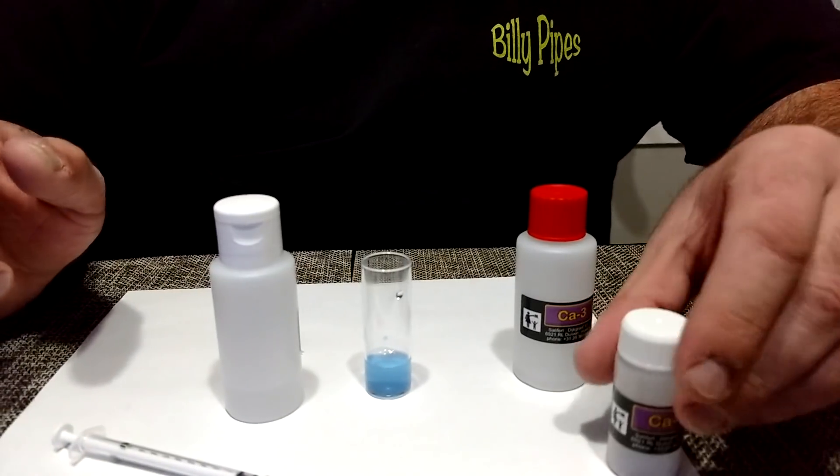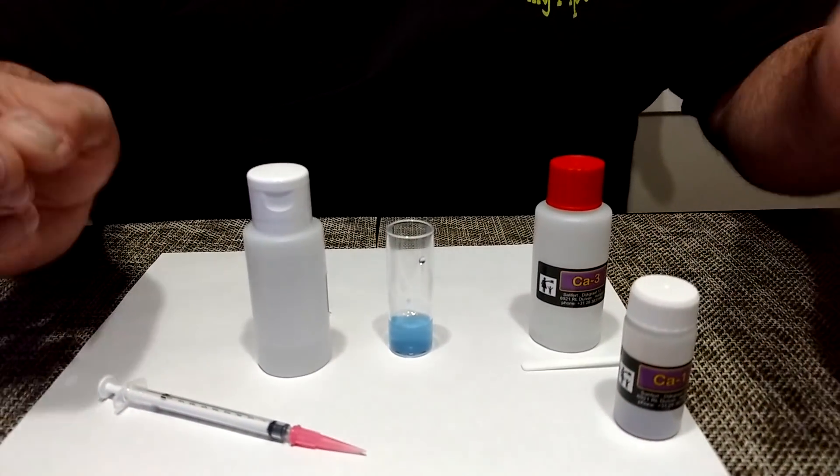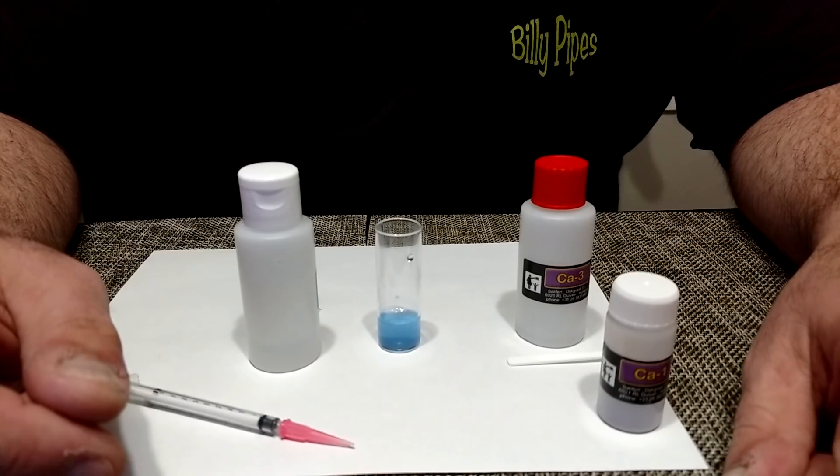So that is exactly how easy it is to use the Salifert calcium test kit. I'll see you guys on the next one.